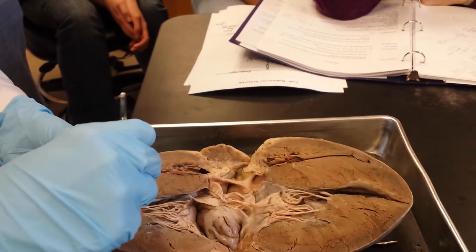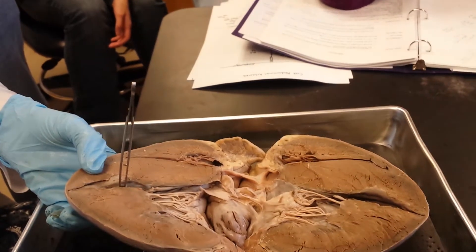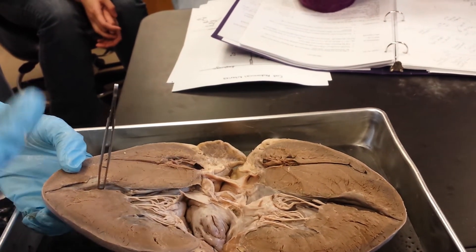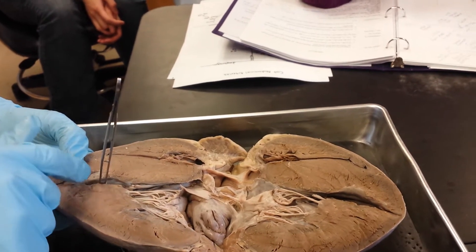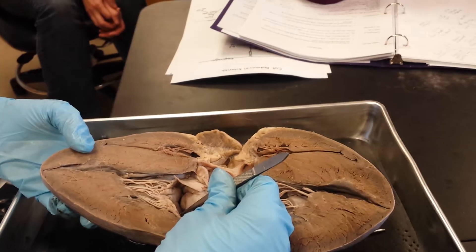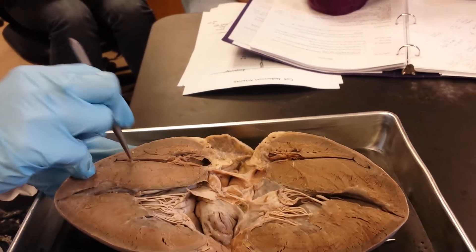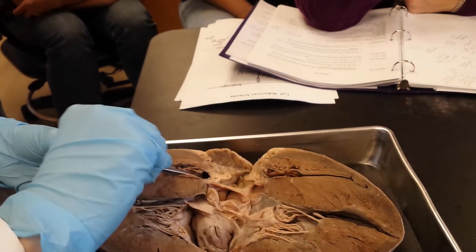What is this chamber? The left ventricle. Remember the chambers: the two upper atria and the two lower ventricles, so this is the left ventricle. What's this one up here above the valve? The left atrium. This is the left atrium. This would be the right ventricle; this would be the right atrium.